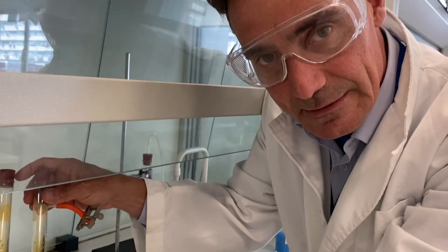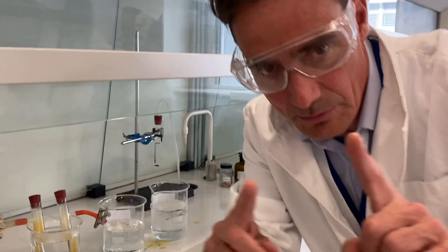So basically what's happened is it's turned now mainly into a brown liquid, yeah? Turned into a brown liquid. So if I just leave that for a moment, can you just join me on the board, let's go over here.